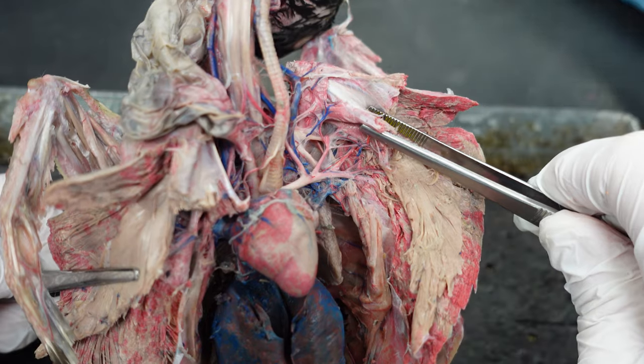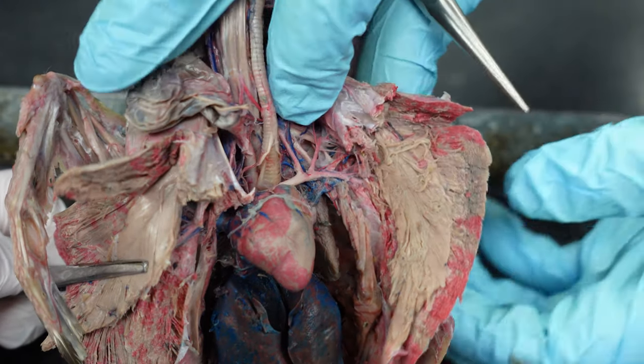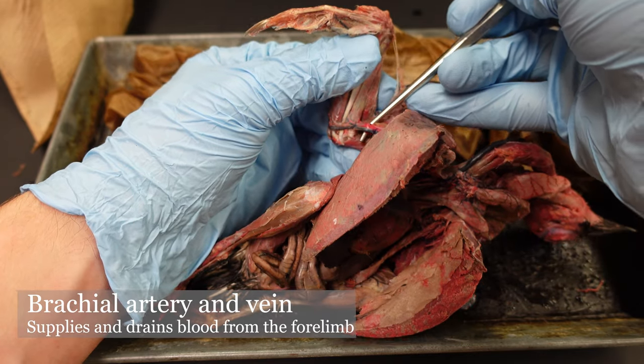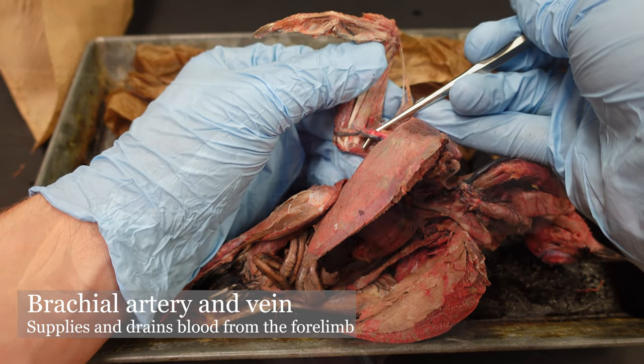Once we get onto the arm, we can flip this over. Here you have the brachial artery and vein continuing onto the arm.